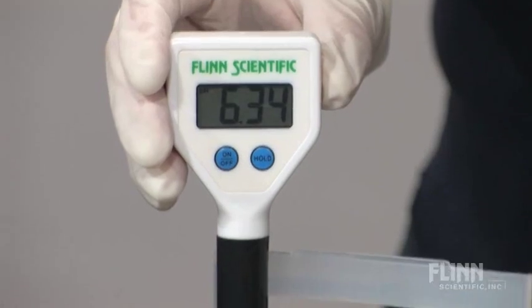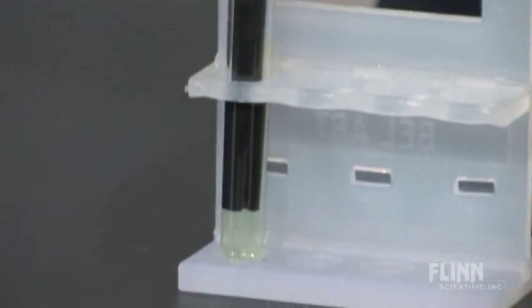Always use and store pH meters in the vertical position. Only submerge the bottom part of the electrode.